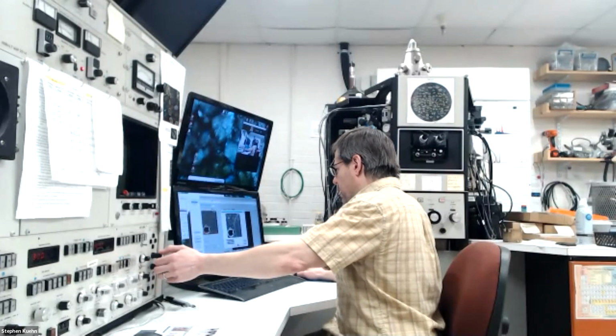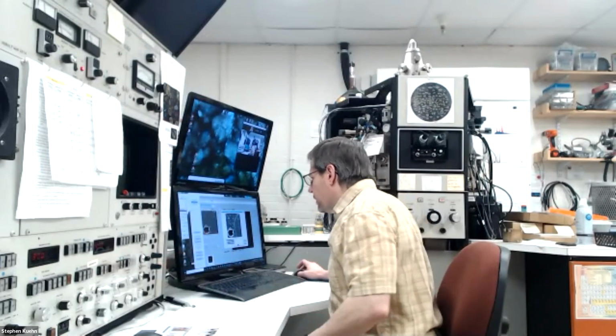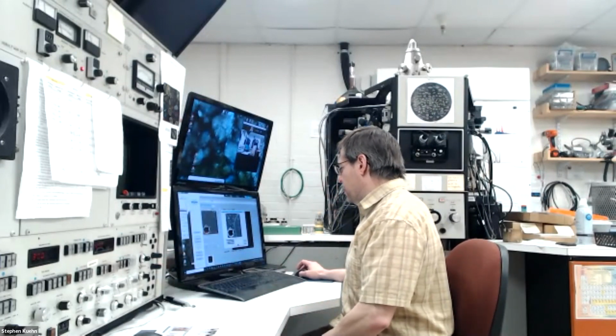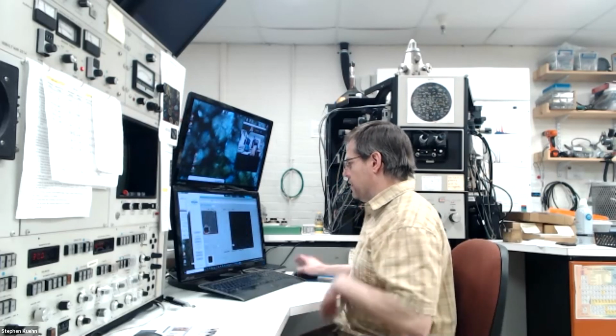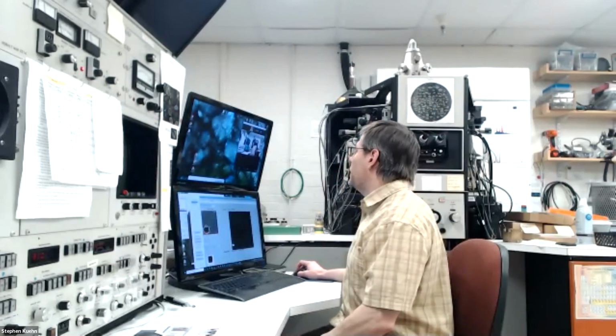Okay. All right. So that looks like that's ready to go. Keep the contrast up kind of high, but that's okay. I want to be able to see the differences between things better. And we got rock O in there already. And okay, let's see.